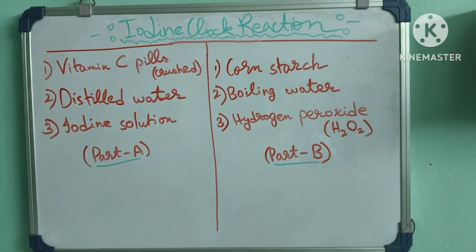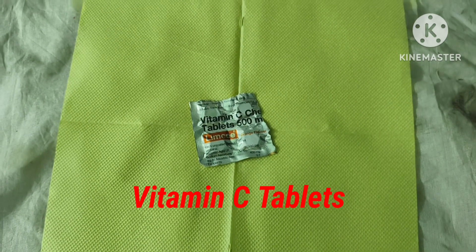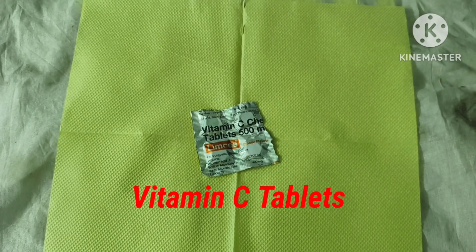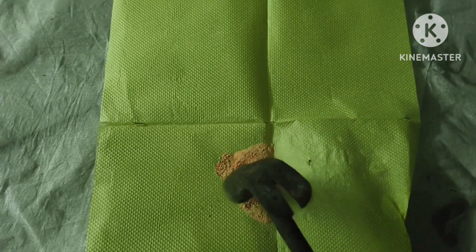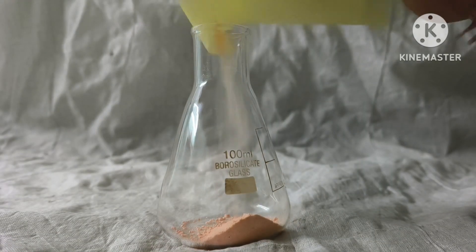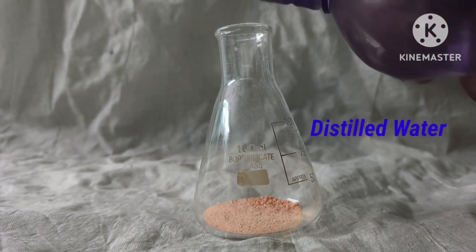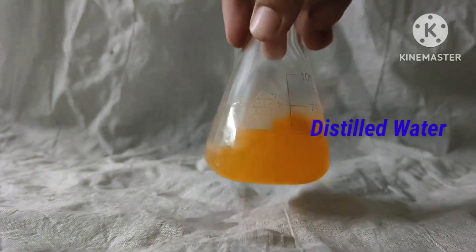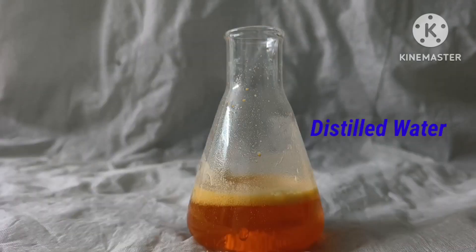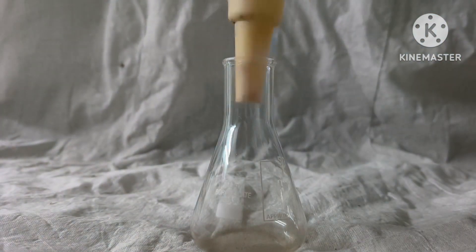Here are some vitamin tablets. Let's crush them. I have crushed them well and now I shall put it into a conical flask and mix it well with distilled water, and filter the solution with tissue paper to get better results.